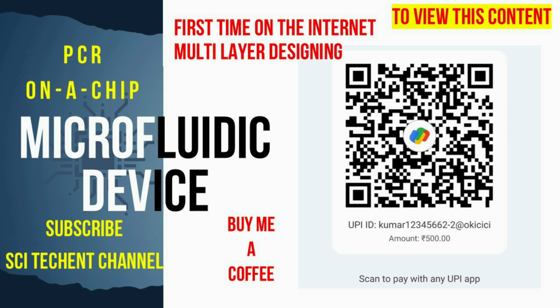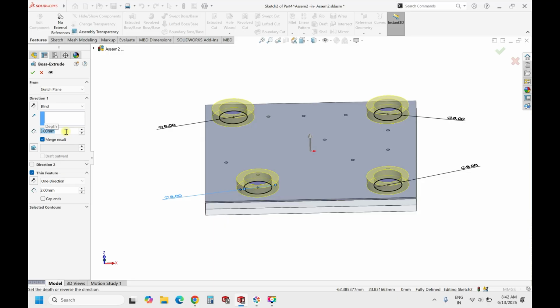So once this is done, go to features, extrude, and this time when you're extruding, don't use the solid option, just make a thin feature and keep it to 2 mm wall thickness. Then we can make it somewhere around 3 mm in height, 3 or 2 mm, whatever is feasible, or even 5 mm. Basically this is to pour the liquid, so we can keep it as 5 mm.